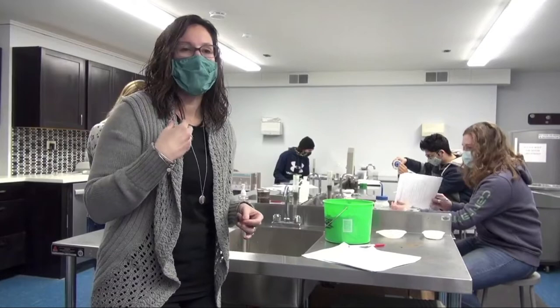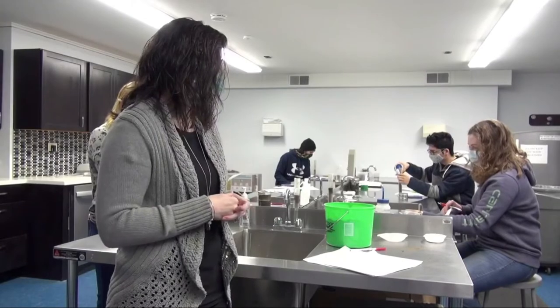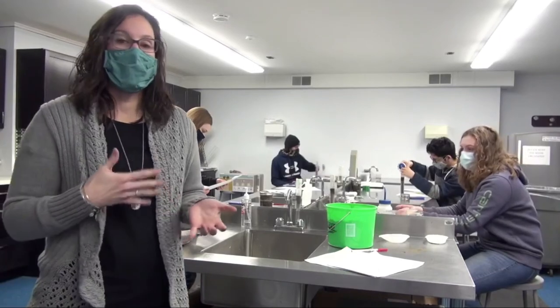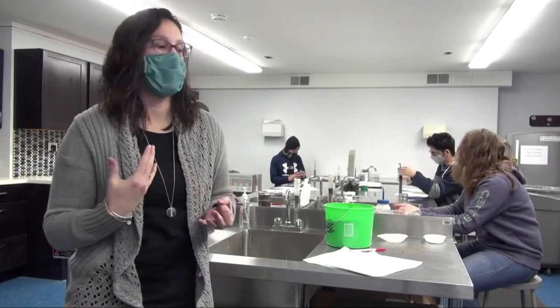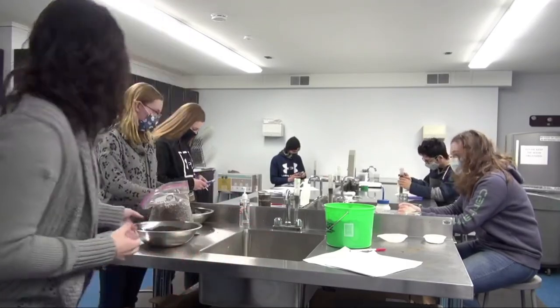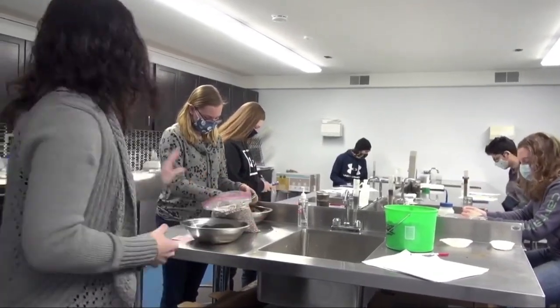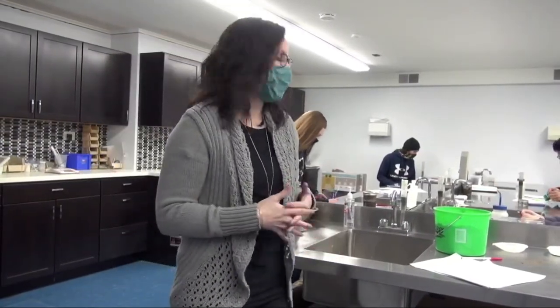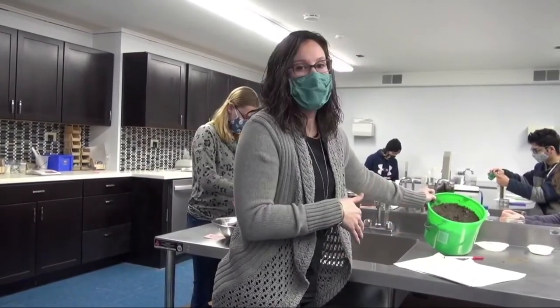The first thing that students are looking at is the texture of a soil. So we're determining the amount of sand, silt, and clay within any given soil sample. You see I've got set out here some different soil samples for students to be testing. I've got Gracie over here who's filling a container, and she's going to talk a little bit about bulk density and porosity in a bit. I've got another soil sample here that's actually native to Kankakee County. So the neat thing is that we're testing soils from many different states as well as in our own backyard. So texture is number one.